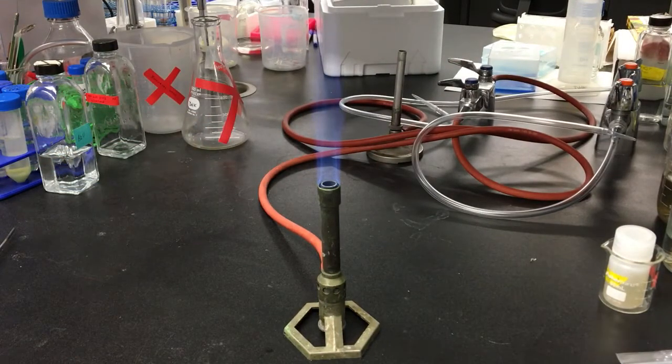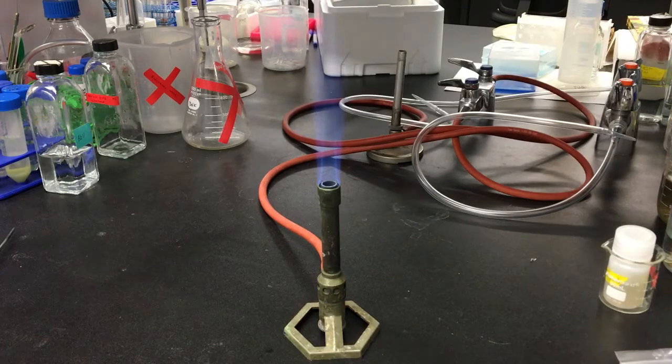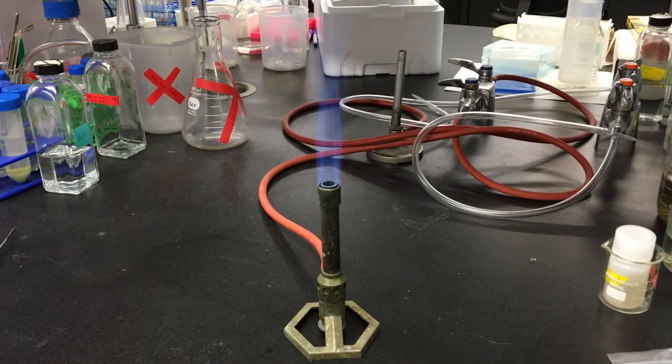You'll need a glass rod and a Bunsen burner. Take care to follow the appropriate precautions when working with a flame.